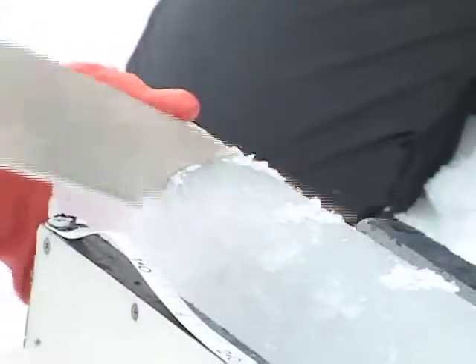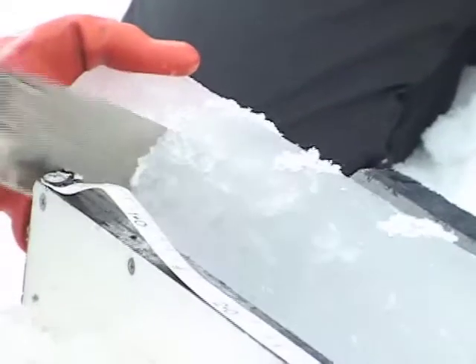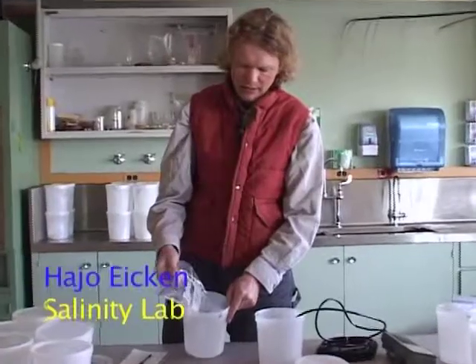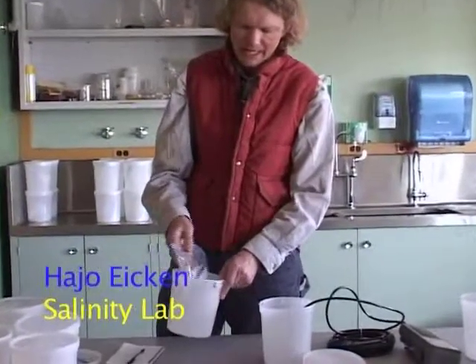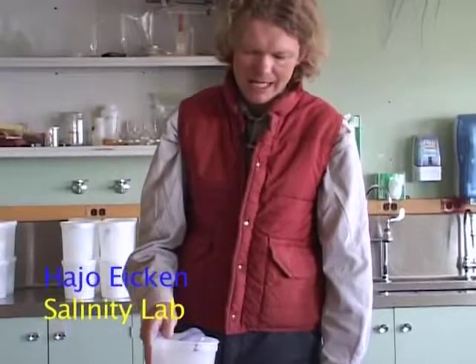We're measuring salinities. These are parts of the cores that we cut up on the ice. And on the ice, we transfer the ice core into one of these Ziploc bags and then set it into one of these plastic containers and bring them in and melt them so that we can measure the electrical conductivity.